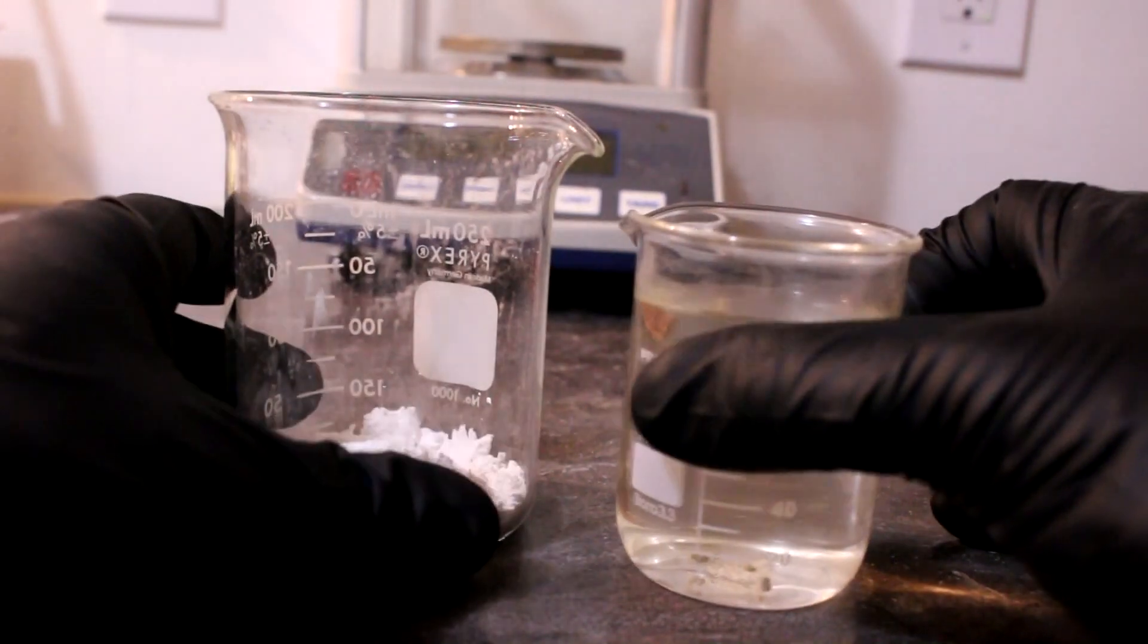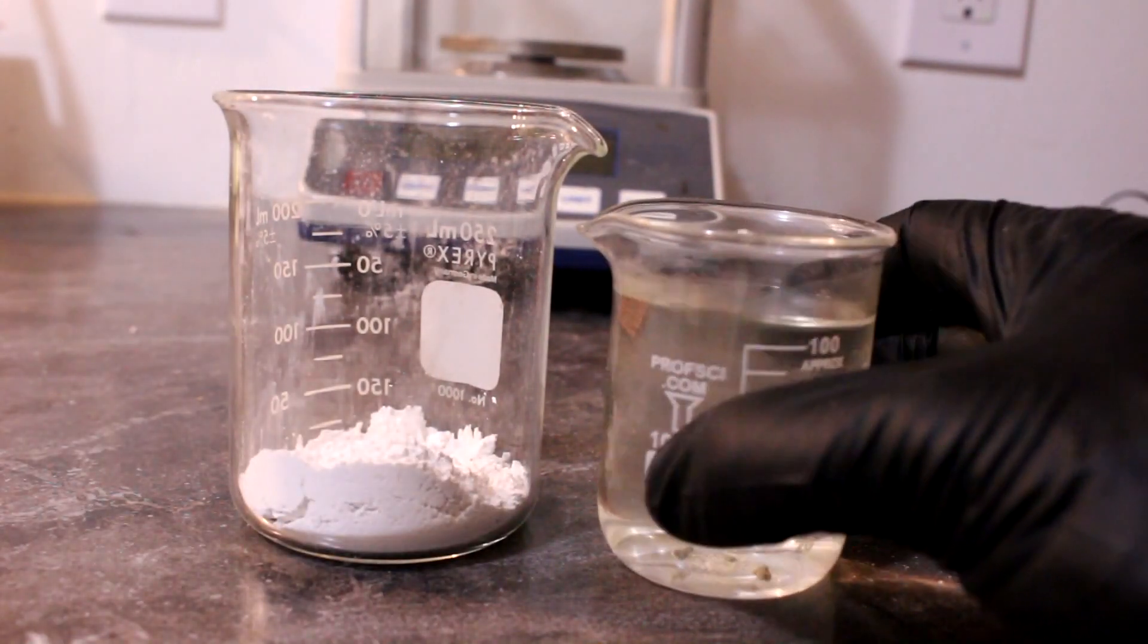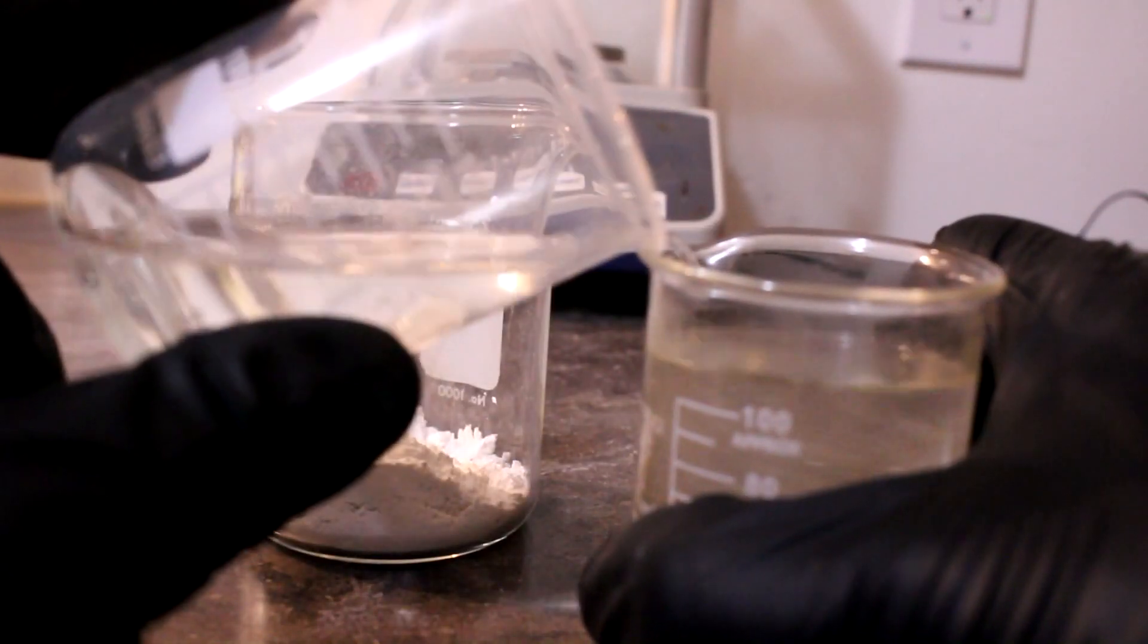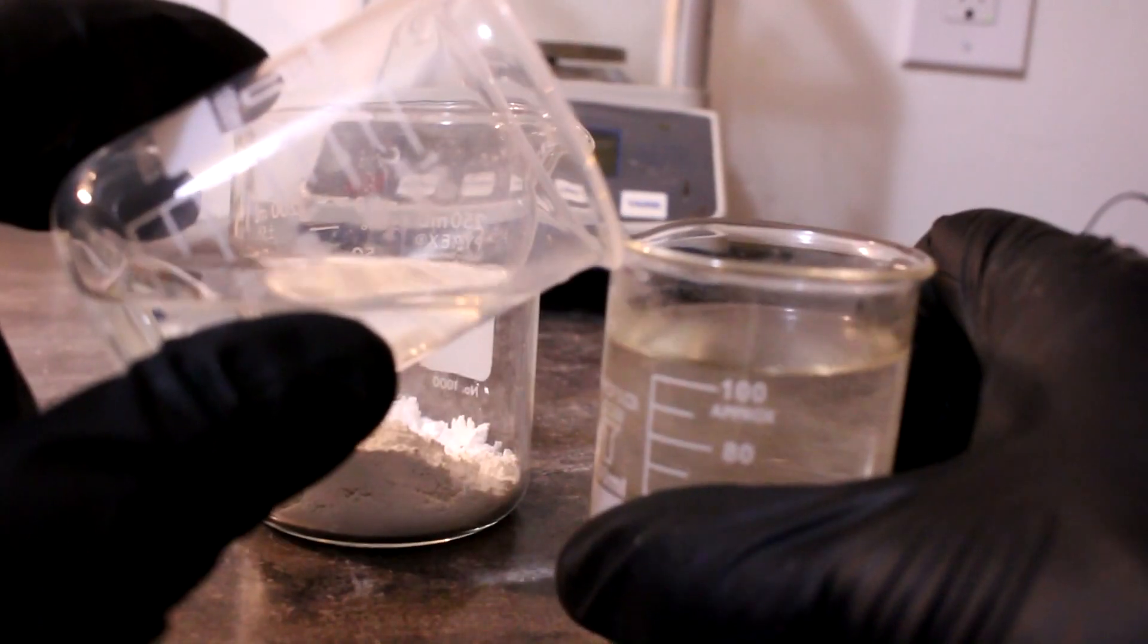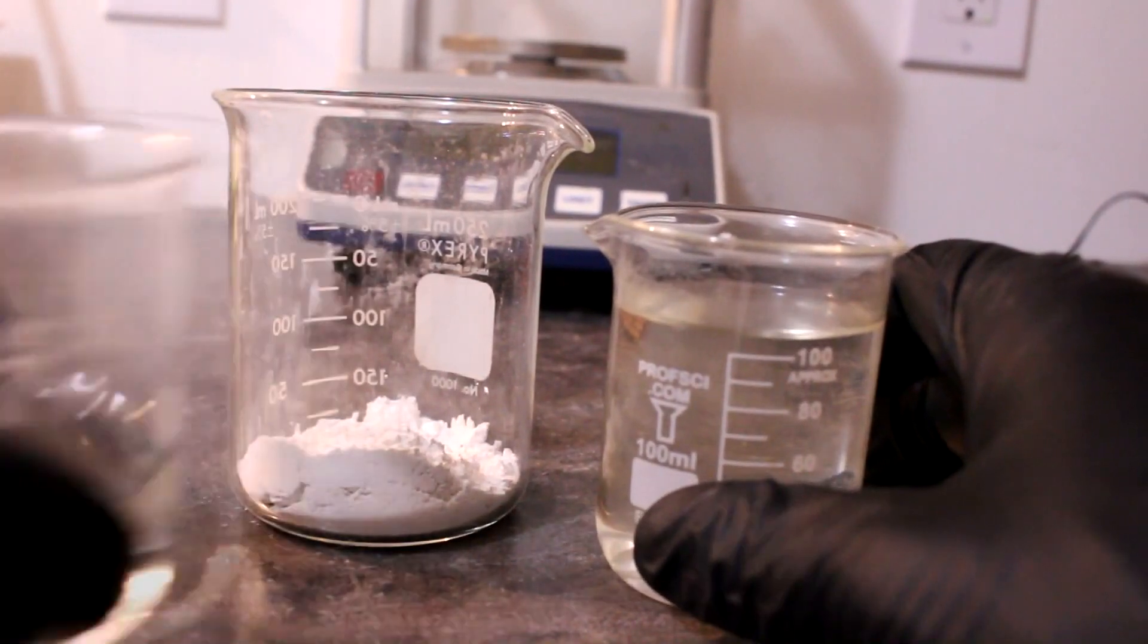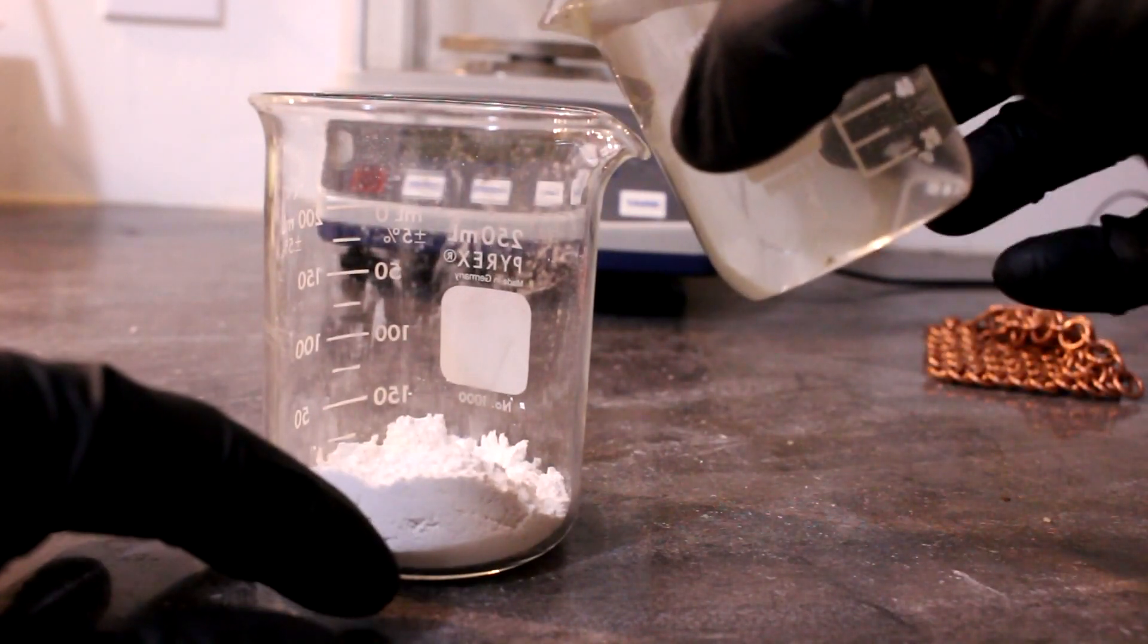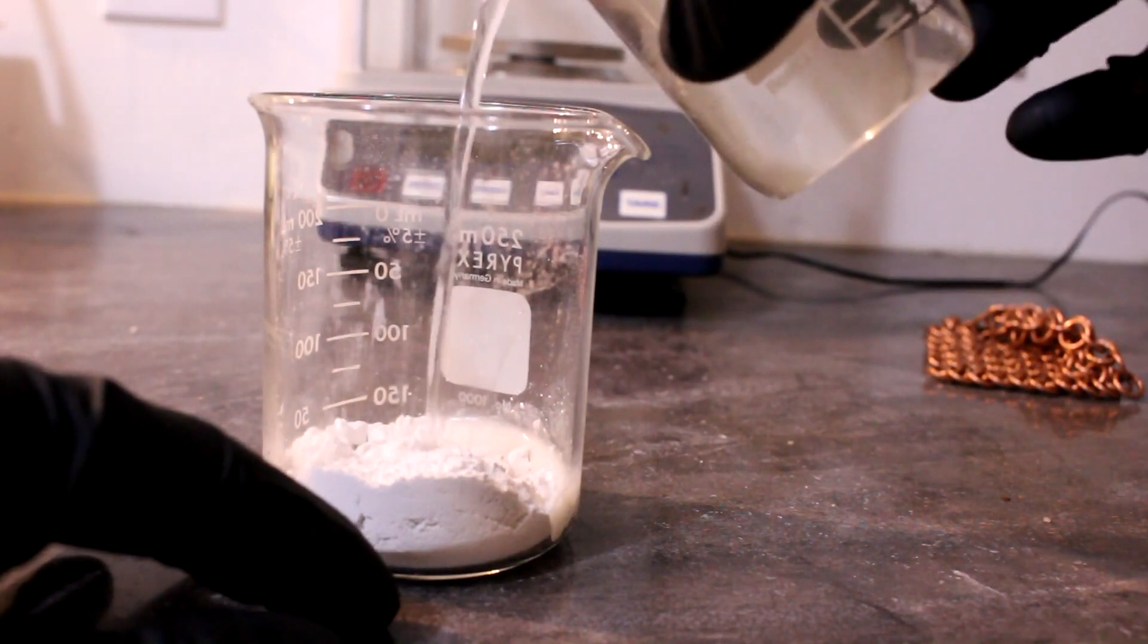Okay, so now that that is mostly dissolved, I'll take some hydrochloric acid here, put it next to the container. You see no white clouds of ammonium chloride forming. I'm just going to take the solution of ammonium sulfate and pour it into the calcium hydroxide.